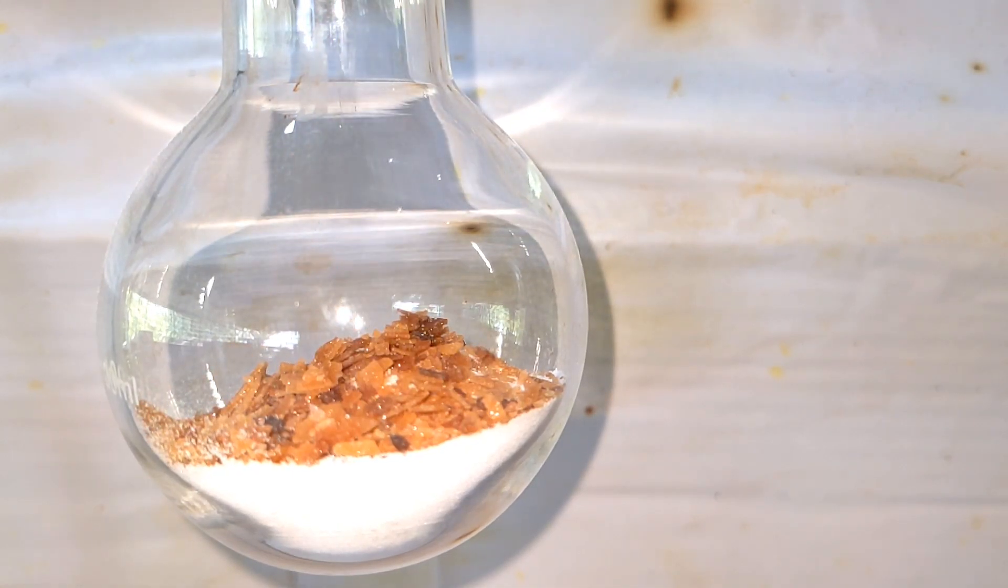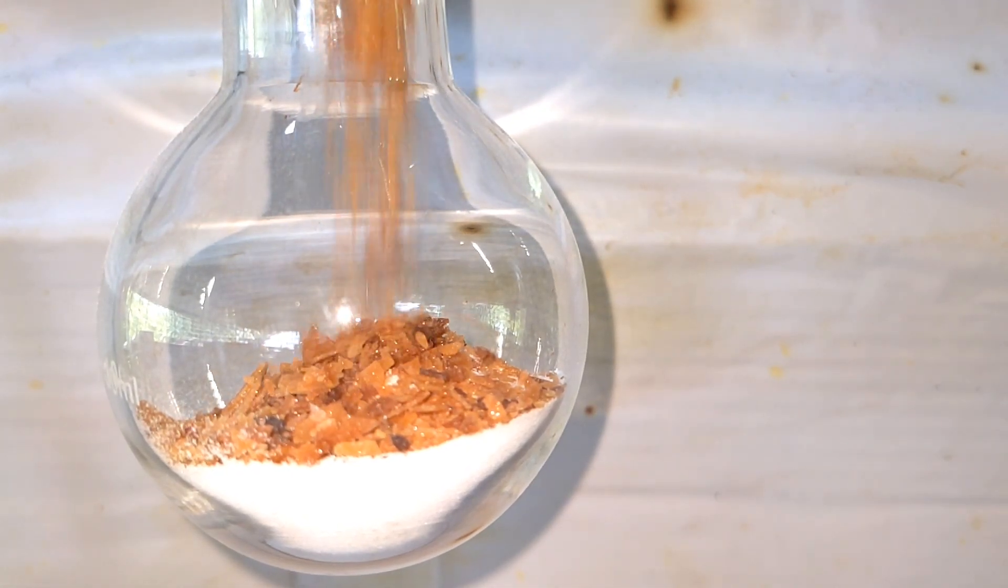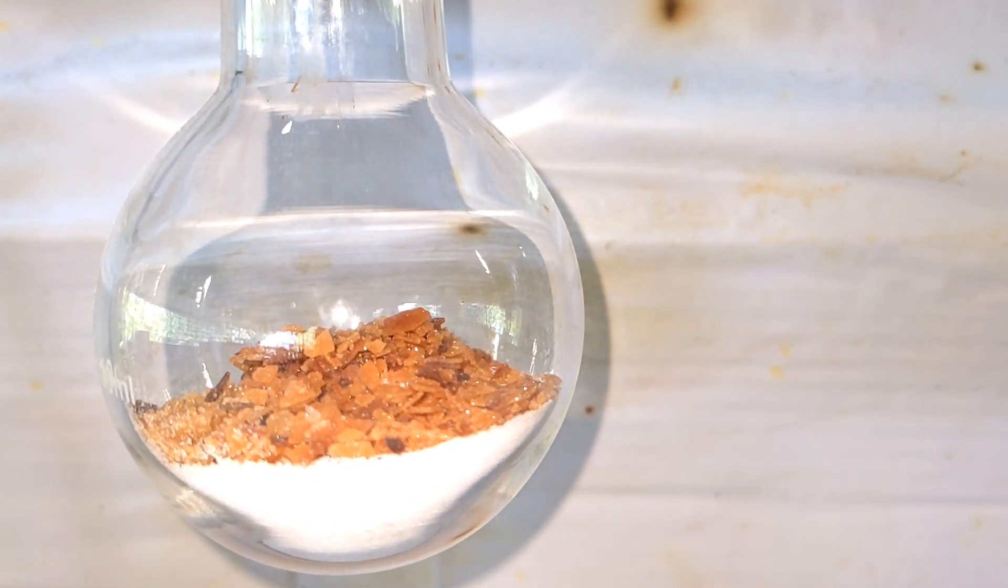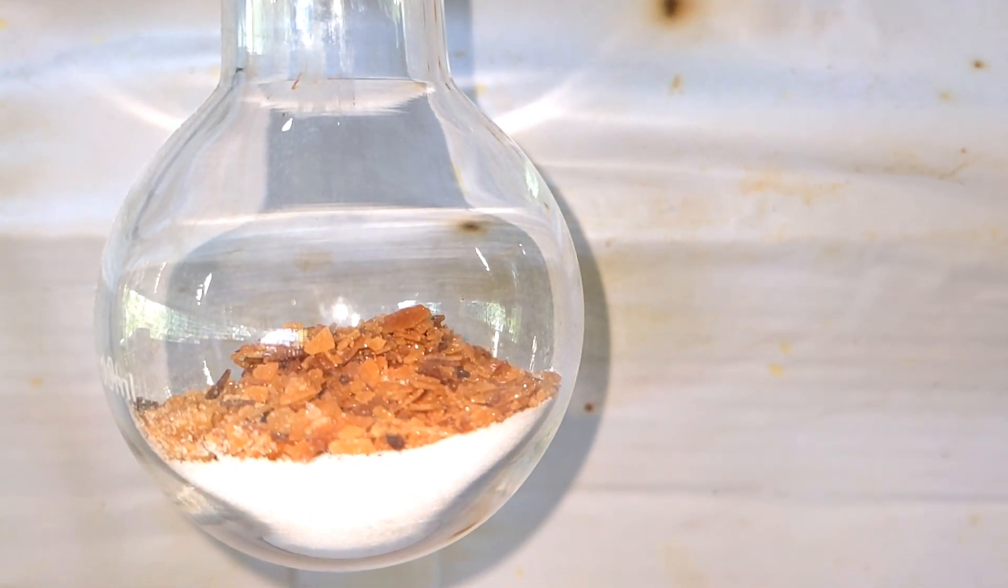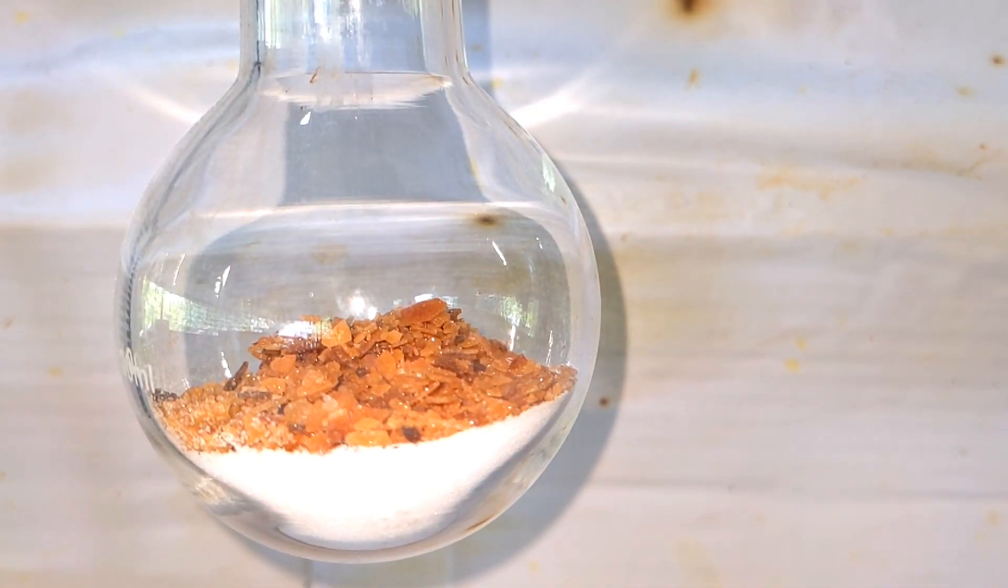Pure resorcinol forms colorless crystals. On exposure to air and light it turns to a pale red color. That is not actually a problem here and it will not affect the reaction.